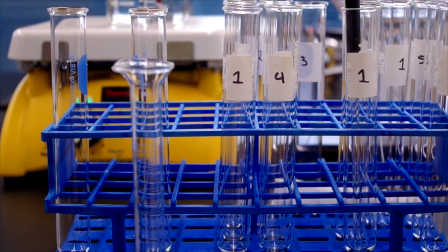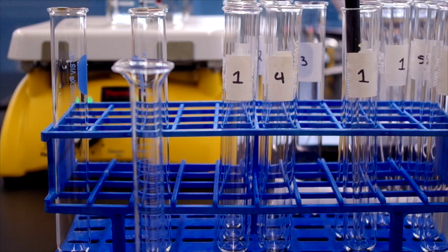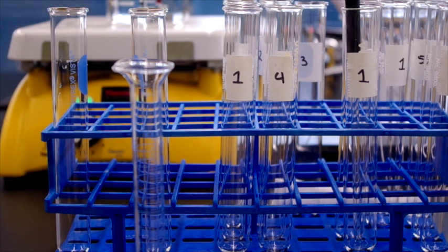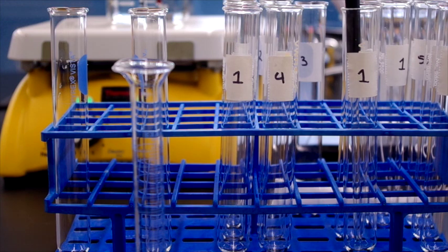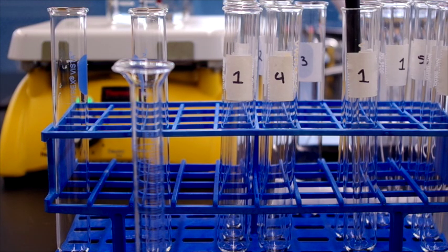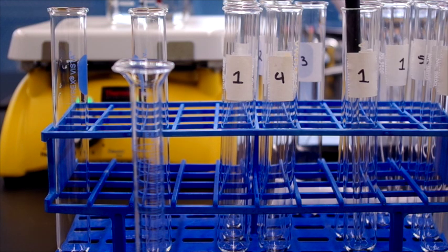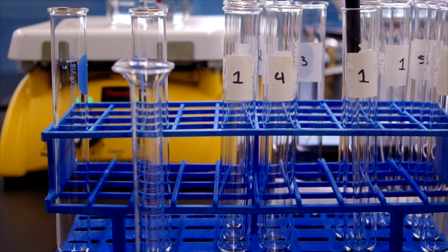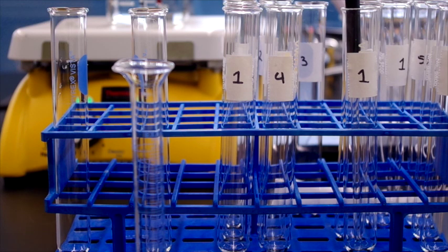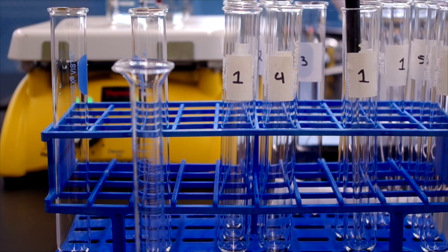Hello and welcome to Chemistry Lab. Today we're going to do the lab entitled Reaction Rates and Chemical Equilibrium. This will encompass six different steps, and there's a lot of data to keep track of, so make sure that you pay attention. The first part of the lab is A: factors that affect the rate of a reaction.